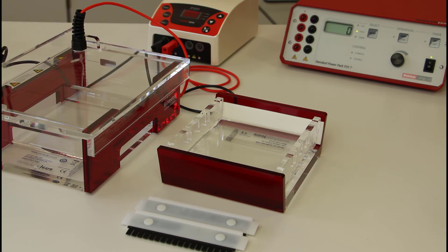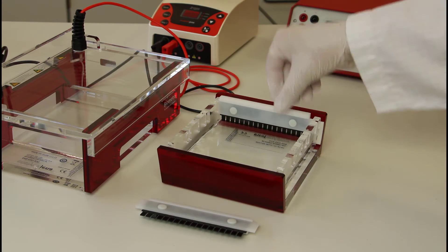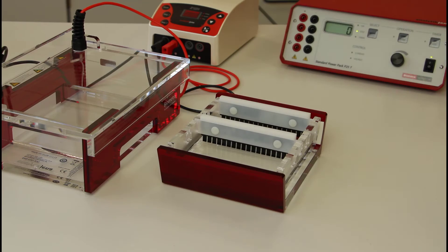In this way, you obtain a uniformly poured gel in one easy step, without any risk of leakage.